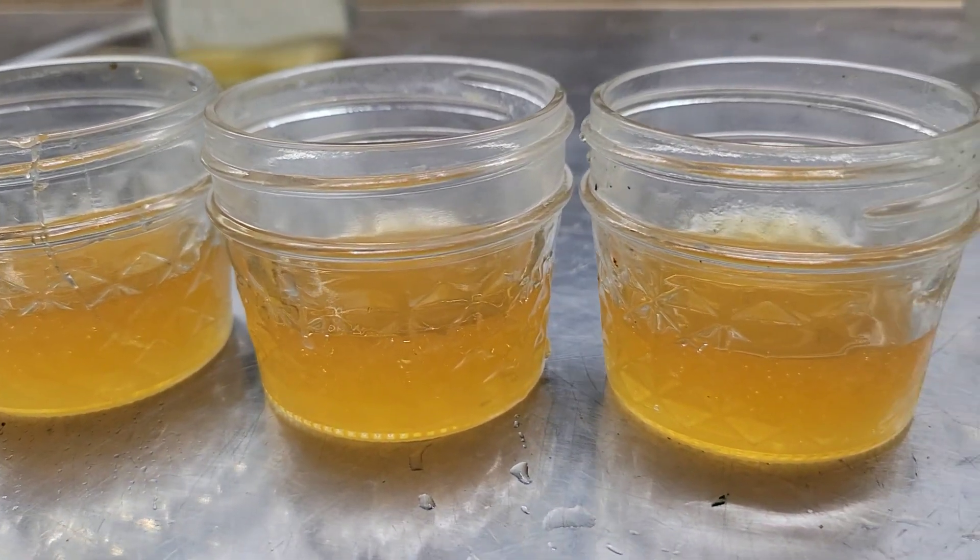Like I said, it's just a simple one-ingredient recipe — honey and water. We're going to use 50 grams of honey to 1,000 milliliters of water, and that'll be basically it for the recipe. Let me show you guys how I put this together — let's get it.